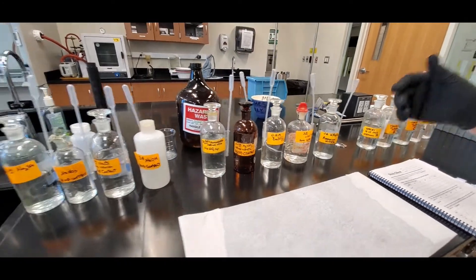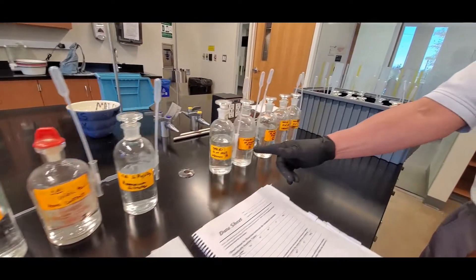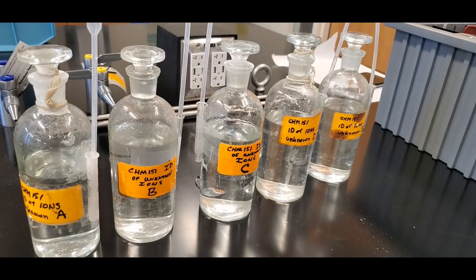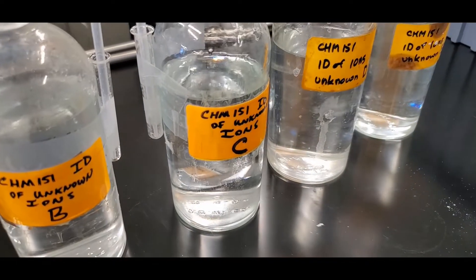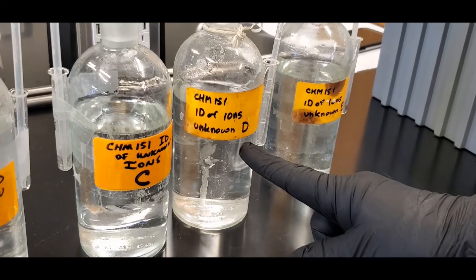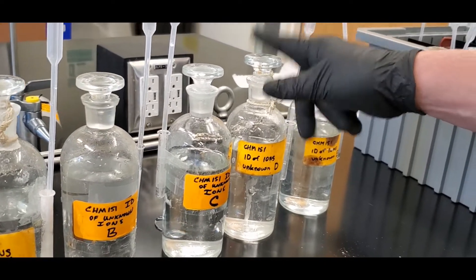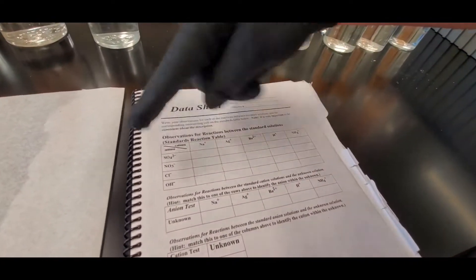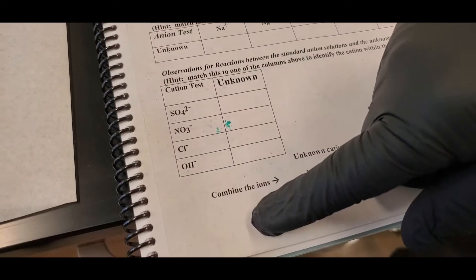These standards are for the first part — the calibration. After the calibration run, you pick an unknown. There are five unknowns: A, B, C, D, and E. They're all clear solutions, and this is like a detective story — we're trying to figure out which cation and which anion are in each solution. Today I'm going to do unknown D. Make sure you use the same solution for both the anion test and the cation test.